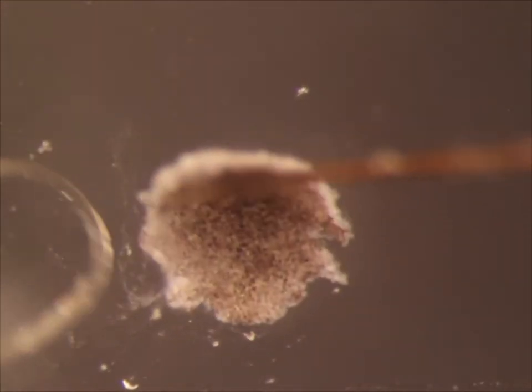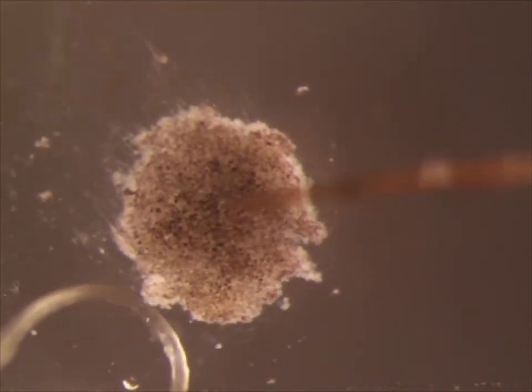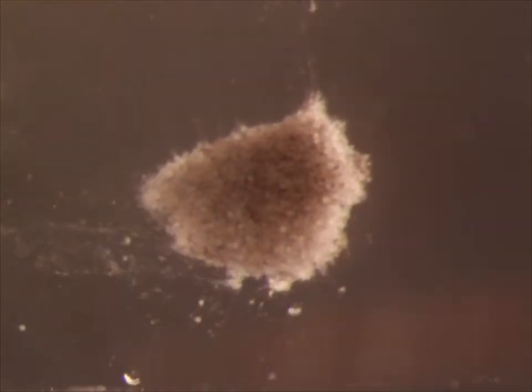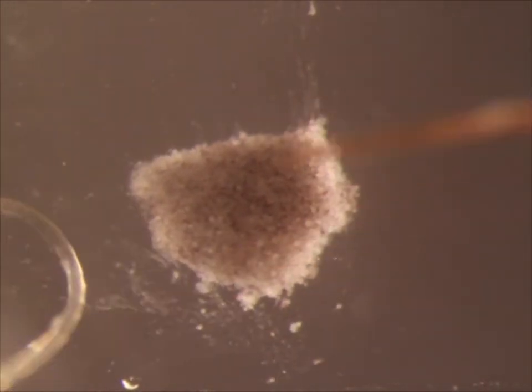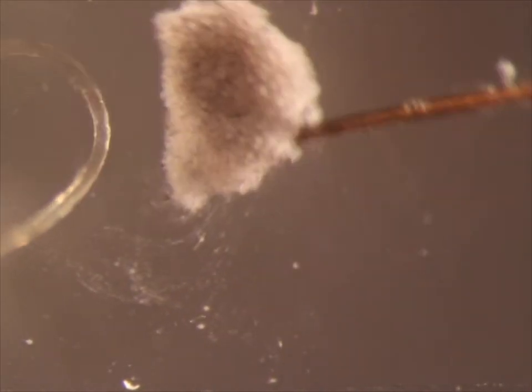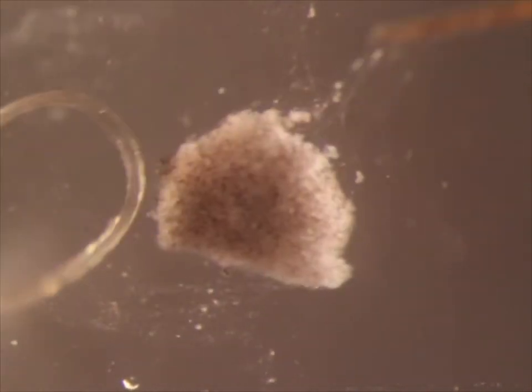When trimming the explant, the pigmented side should be down. Use the eyebrow knife and quick jerks to trim the explant. The hair loop can be used to hold the end of the knife, which helps with creating straight lines.